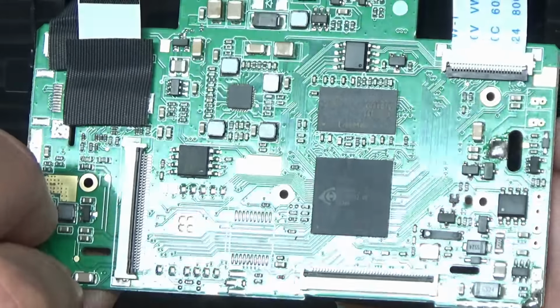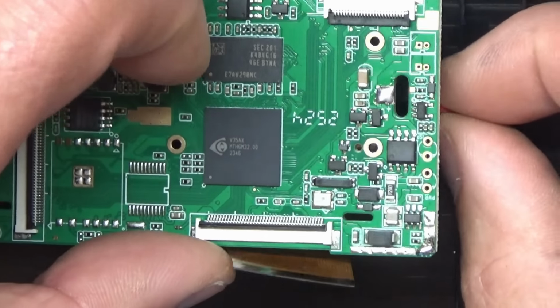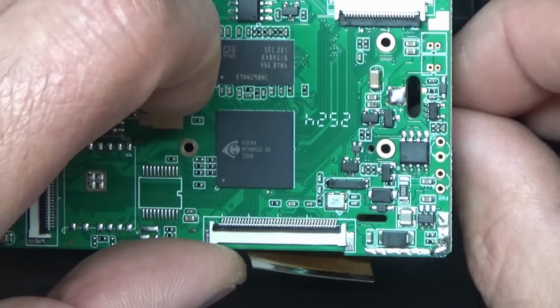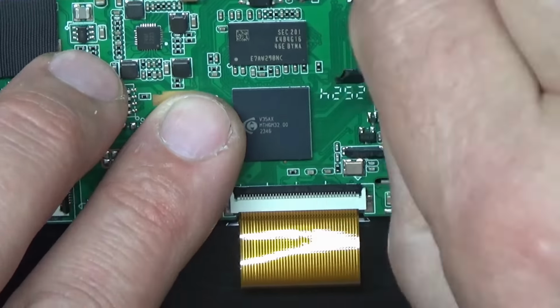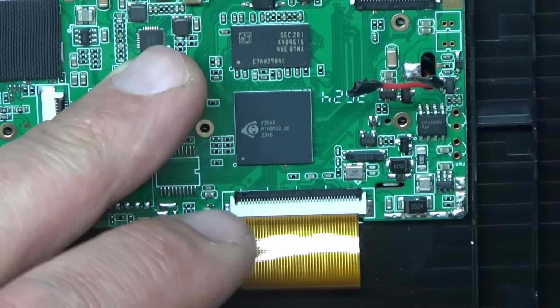Right, I'll put these two wires back through. I'll try it because there's not a lot of cable here. Right, let's see if I can pop those 4 screws back in.